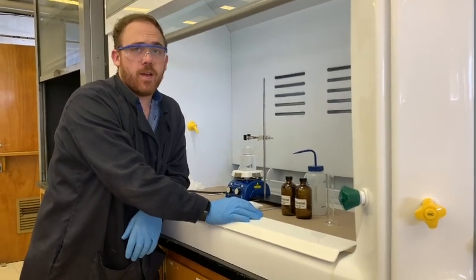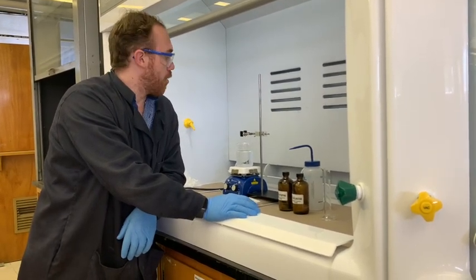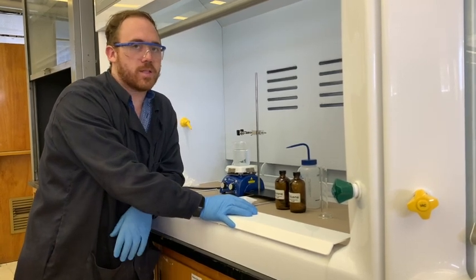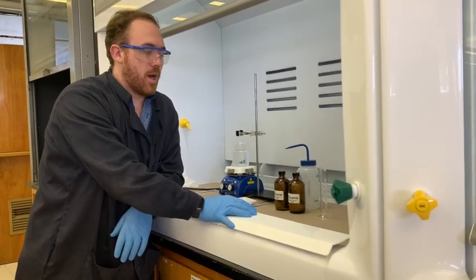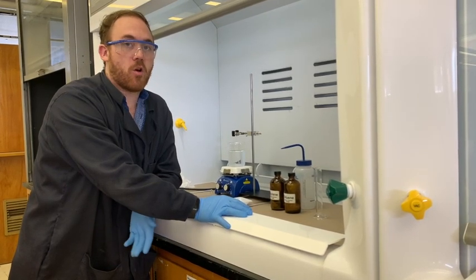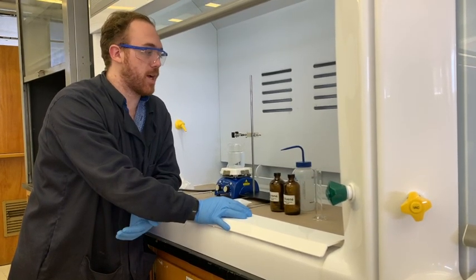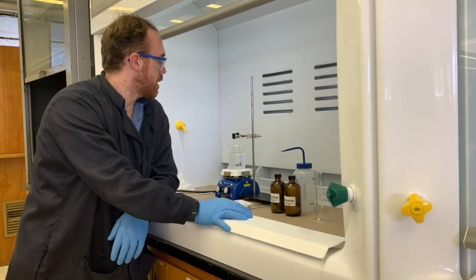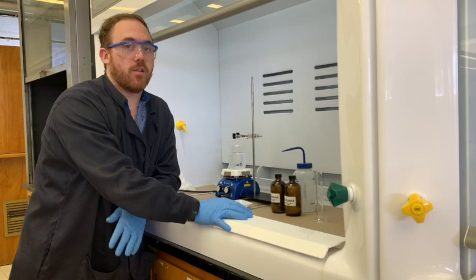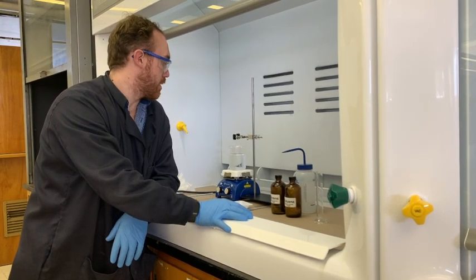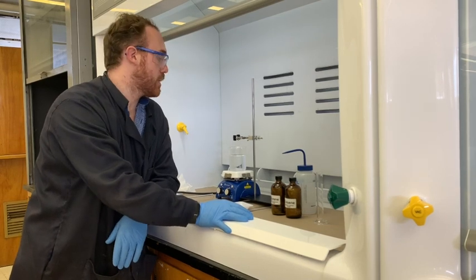Alright, so today we're going to do a little radical polymerization with some styrene. You all have polystyrene that you use when you're going to get takeout or when you're working with sometimes harder polystyrene, which are great for some kinds of plastic inserts and cheap plastic toys. Styrene is in a lot of different places and it's a very robust polymer, very popular because of how inert it is and all of its different uses.